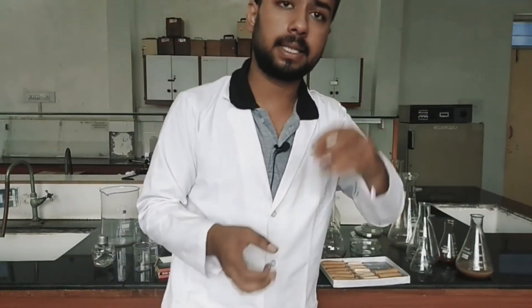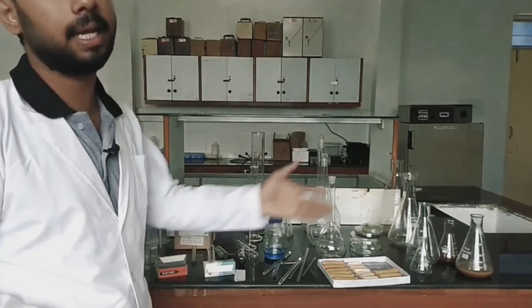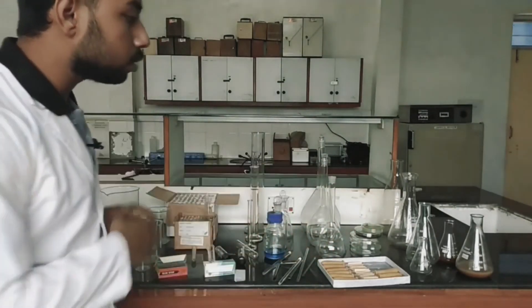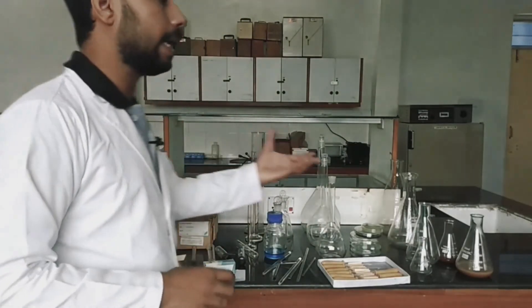There are different types of glasswares such as micro pipettes, sucking pipettes, and distillation units — there are different varieties. But these are the generalized things which are used in microbiology in daily practices or in any laboratory in daily practices. You just have to know the name of all of them because they are very important when you are going into any laboratory practice such as microbiology.